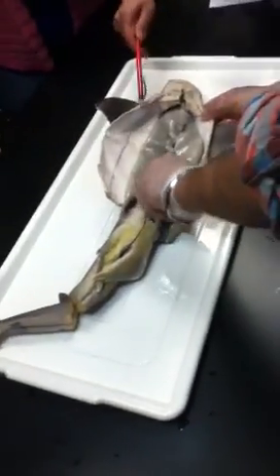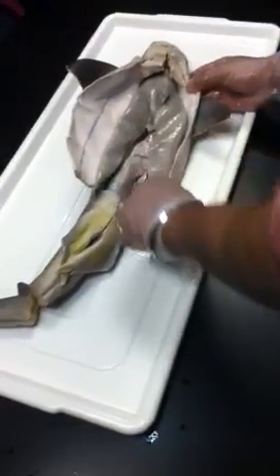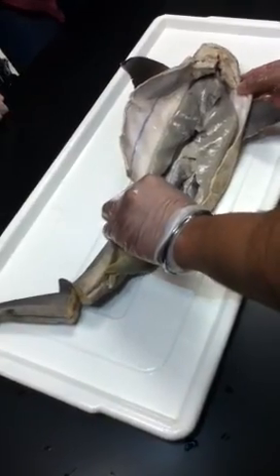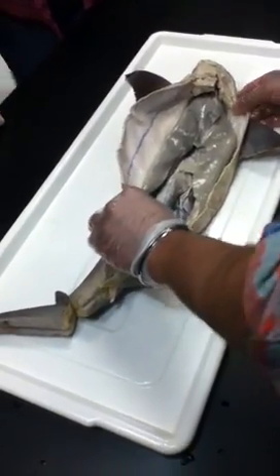That's the liver right there? Yes. That's the one, two, three. Three lobes. What is the function of the liver? That's not a question on here. Might answer. Go for it.